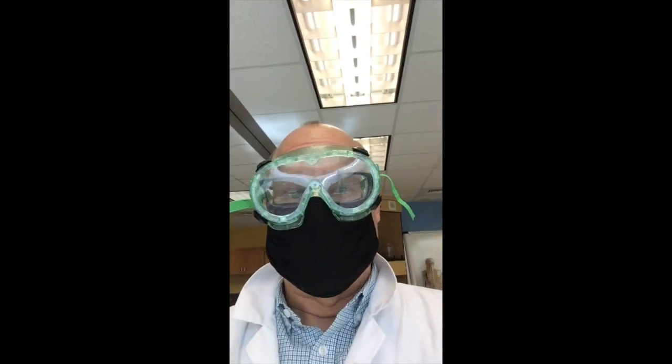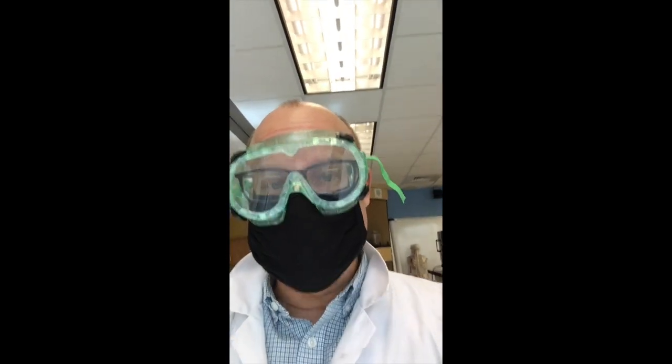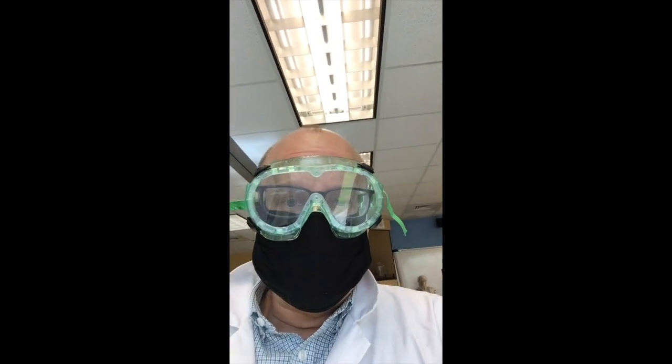Here we are back in the lab. What we're gonna do back in the lab is we're gonna analyze your food. By analyzing your food, we're gonna find out which macromolecules are in your food. Is it a protein? Is it a lipid? Is it a carbohydrate? Which, if you'll remember, is monosaccharides and polysaccharides.